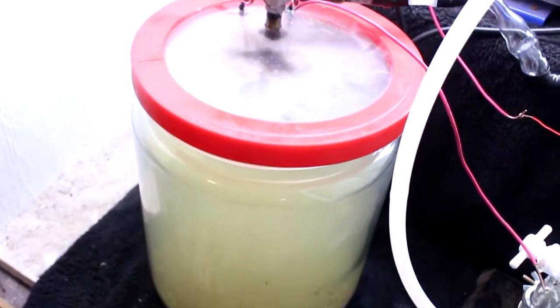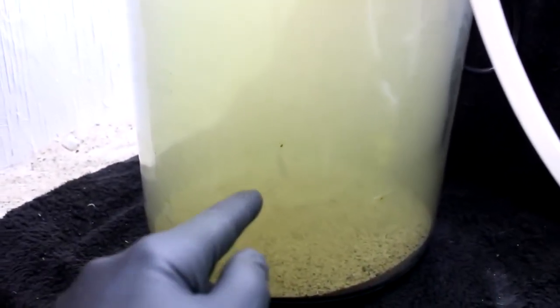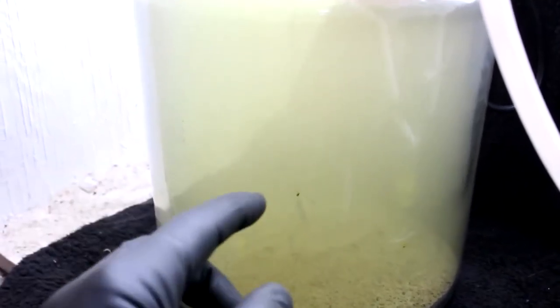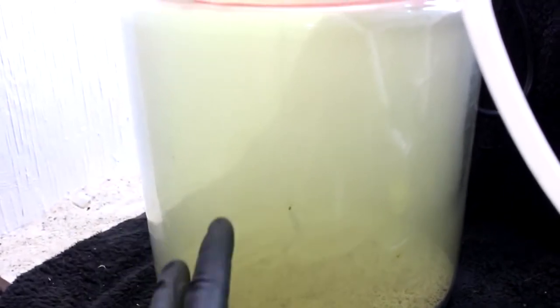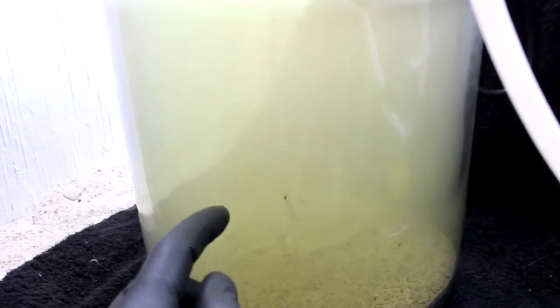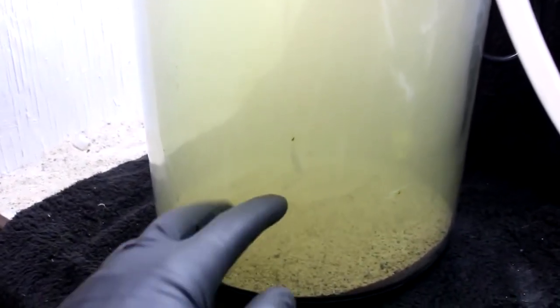I think the reason for that is that chlorine just can't burn carbon very well, especially not at low pressure. So it was able to burn the hydrogen but not the carbon, so the carbon is ending up here as soot. The hydrogen that's burning is producing hydrogen chloride, but it wasn't producing very much energy, so it's not able to sustain the fire very well. The metal, on the other hand, burns chlorine very well, and I think it actually completely burned up.